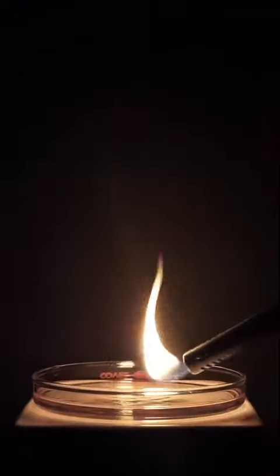Now when I try it, I get a flame that has almost no color. There is a slight hint of yellow, but besides that, it almost looks like it's in black and white.